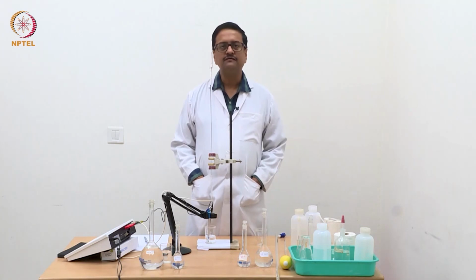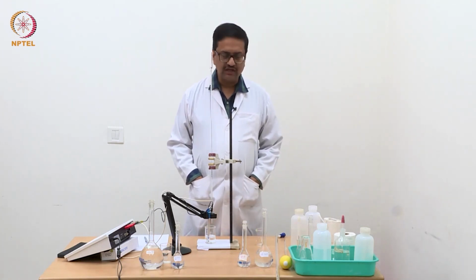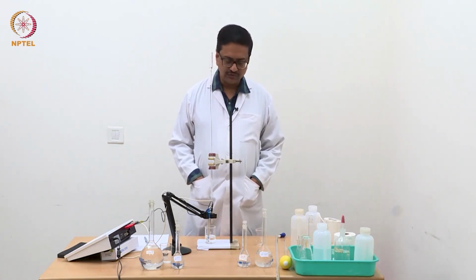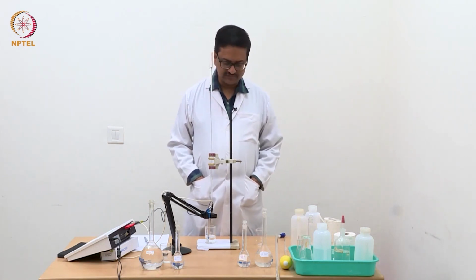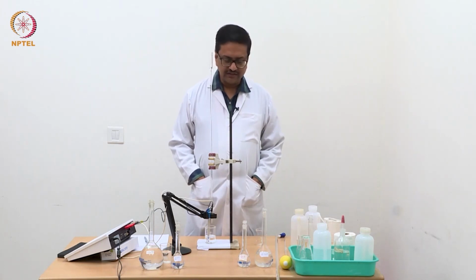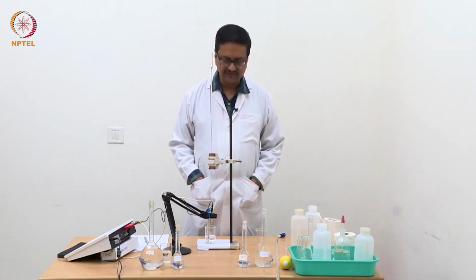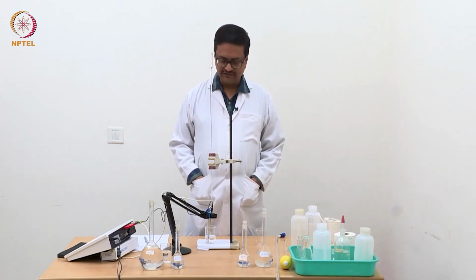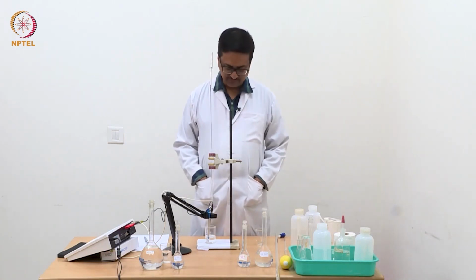The theory part of this has already been discussed in the lecture sessions. So now I am going to demonstrate 3 experiments using conductometric titration as a tool, and we will see how a conductometry experiment is conducted, and then you will see how the conductivity changes for different analyte solutions, as was theoretically discussed during the lecture.